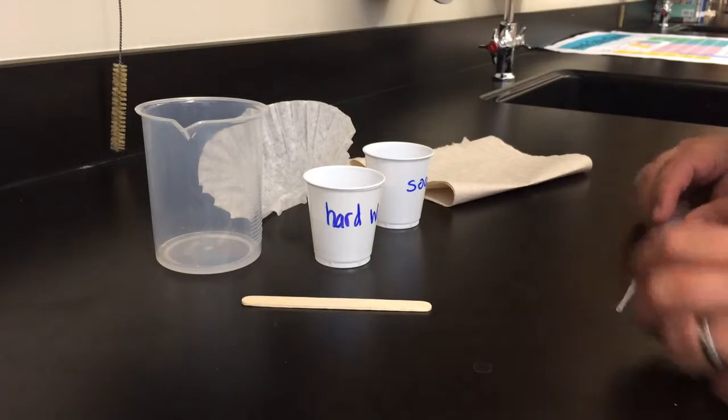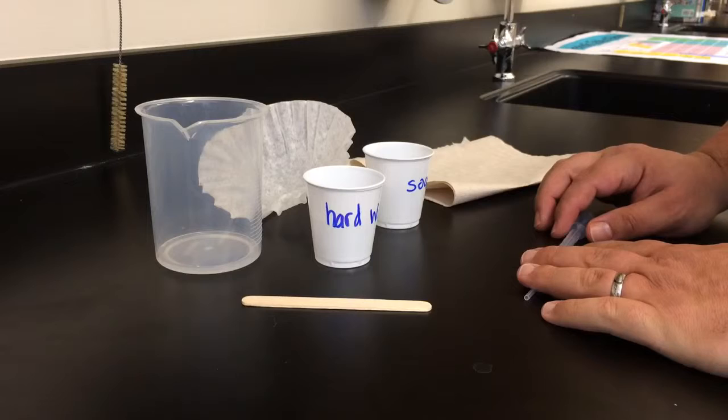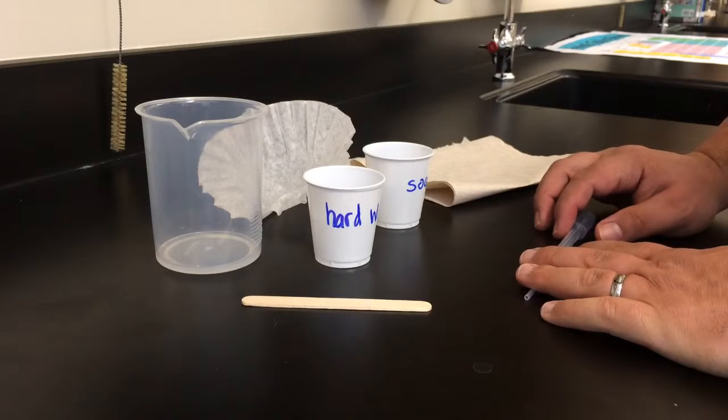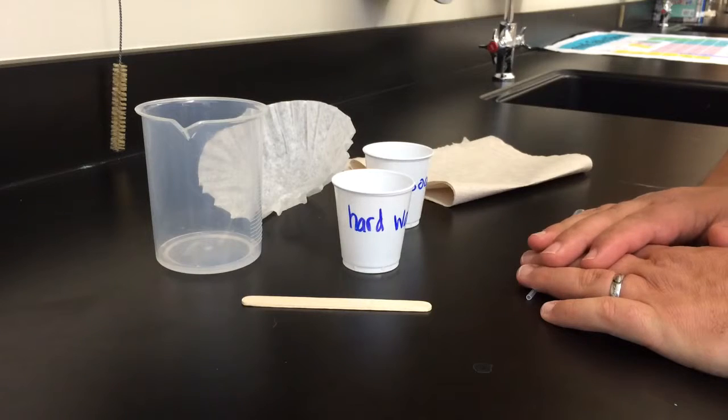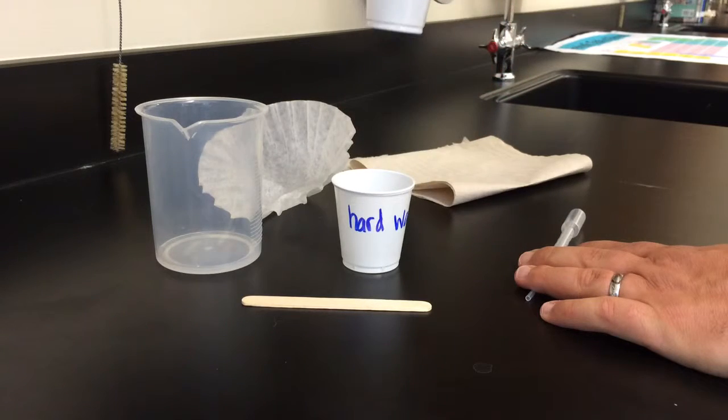Okay guys, so this is your final pre-lab demonstration video. This is reactions for the reaction of hard water, which is water with lots of minerals, with soapy water.